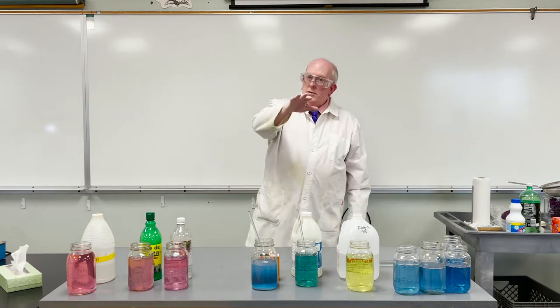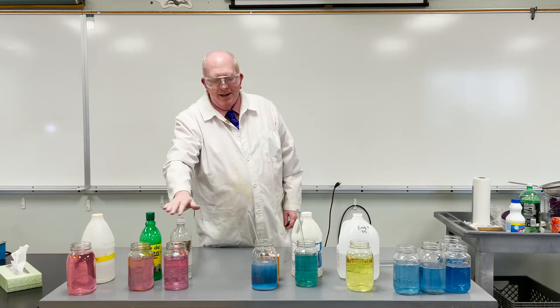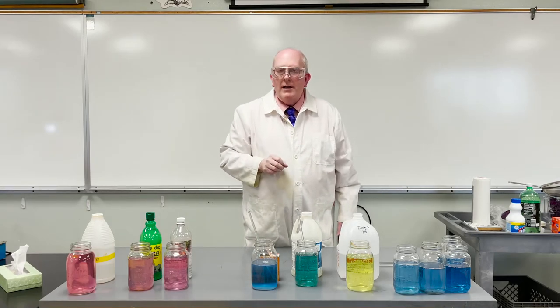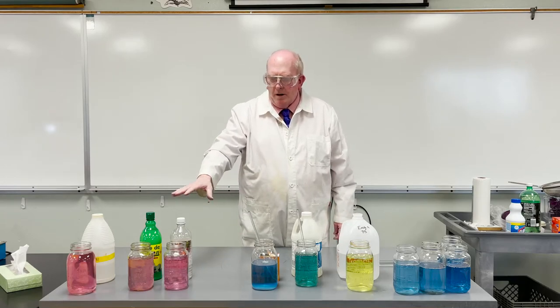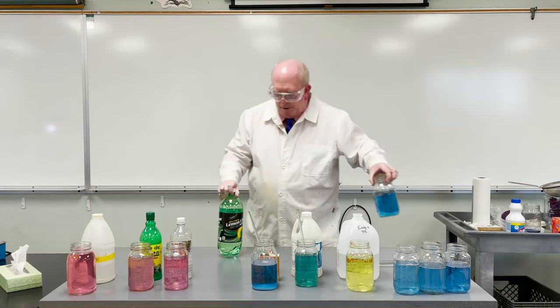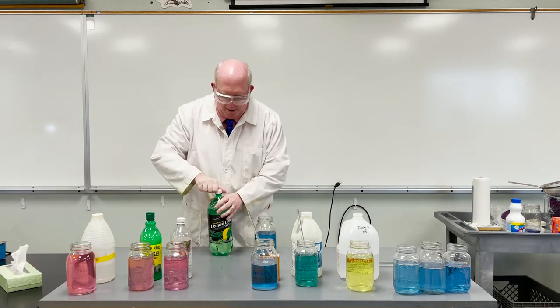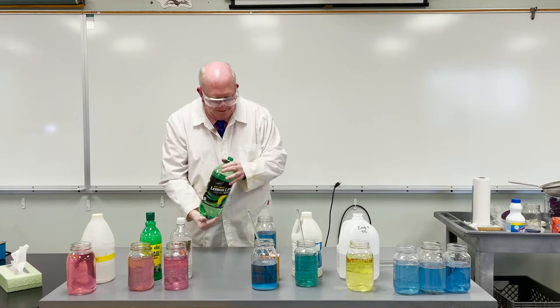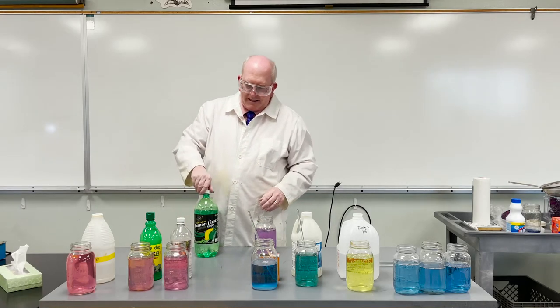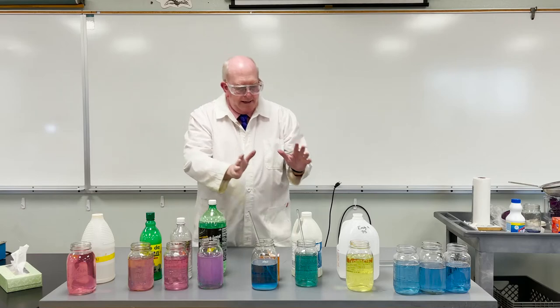I want you to do some thinking. Notice both of these are actually foods, and both of these can be considered cleaning products. In general, cleaning products tend to be basic. Foods aren't always, but a lot of the ones that you're familiar with are. That's another good example — I got some lemon-lime soda here. Not 7-Up because that stuff's expensive; this is the Vons brand cheap stuff, 79 cents for a 2-liter bottle, and Morgan is notoriously cheap. Let's dump this in here. We are seeing something that's acidic again. Foods that are acidic, cleaning products that are basic.